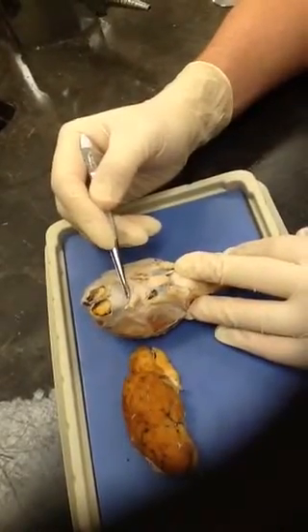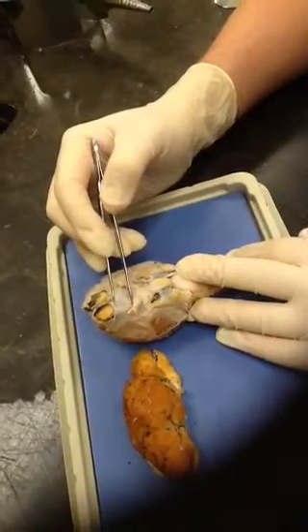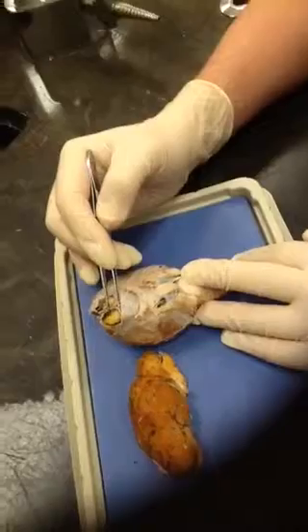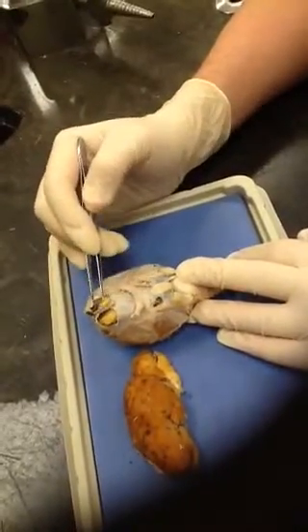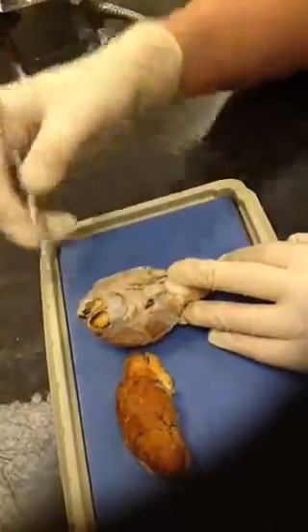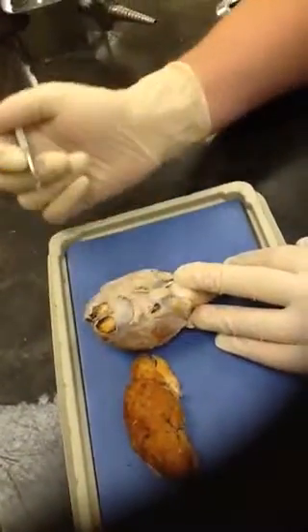Then finally, you have underneath the dura mater here, you would see your olfactory nerve, and at the end of the olfactory nerve, it swells to form these olfactory bulbs. So you can see them here at the forebrain, which it's going to send out the nerves through the cribriform plate to eventually cause smell. Okay. And that's it. Thank you.